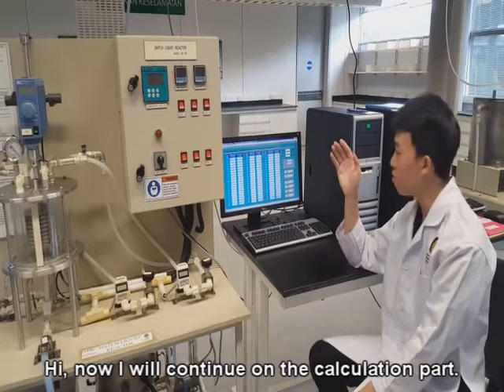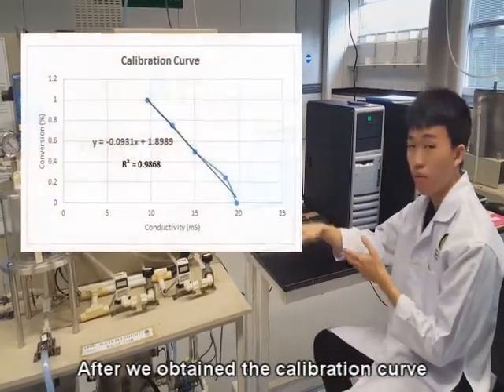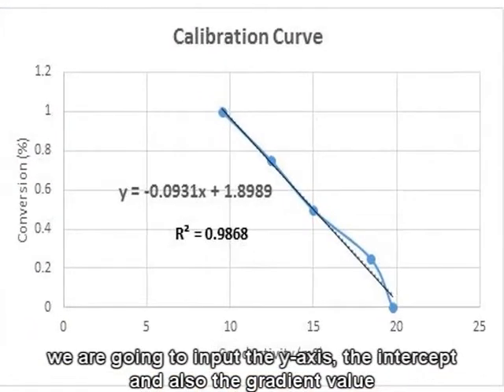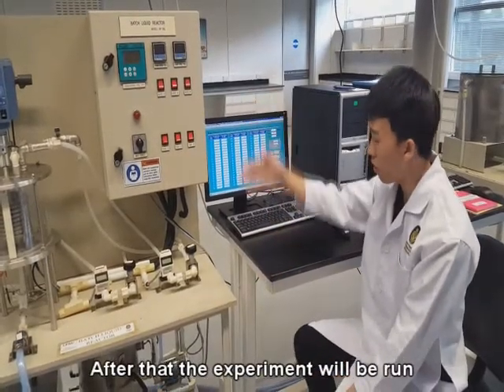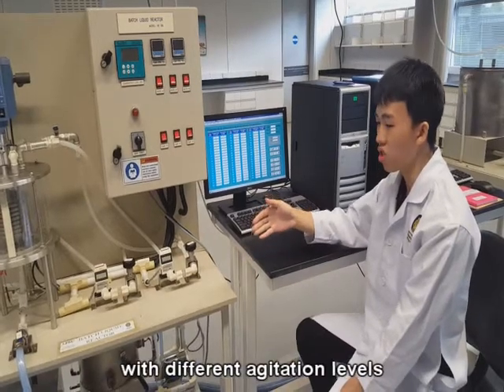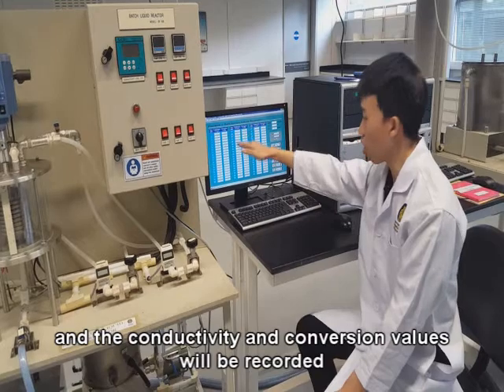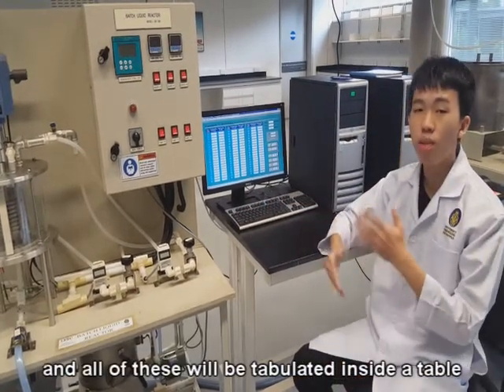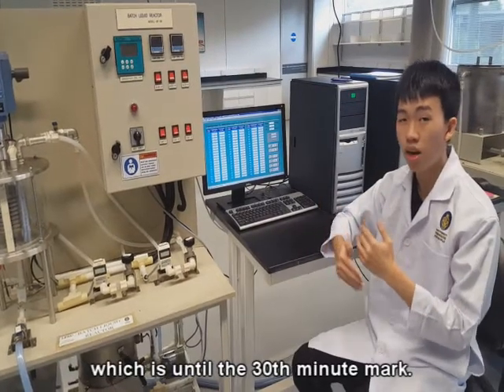Hi, now I'll continue with the calculation part. After we obtain the calibration curve from the 5 solutions, we're going to input the y-axis intercept and also the gradient value into the computer system. After that, the experiment will be run with different concentrations and different agitation levels, and the conductivity and conversion values will be recorded. All of these will be tabulated inside a table, until the 30th minute mark.